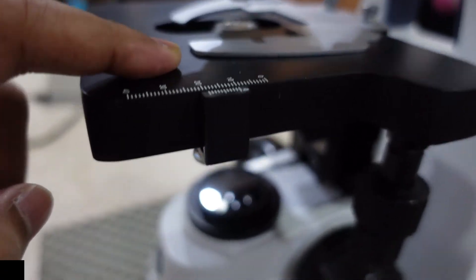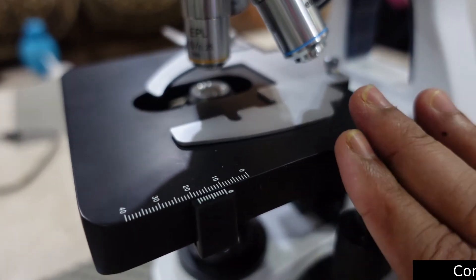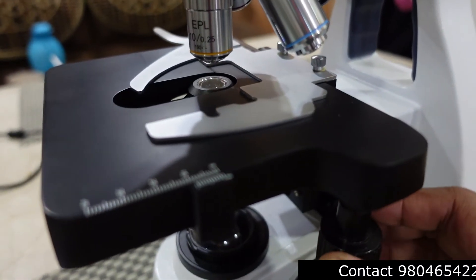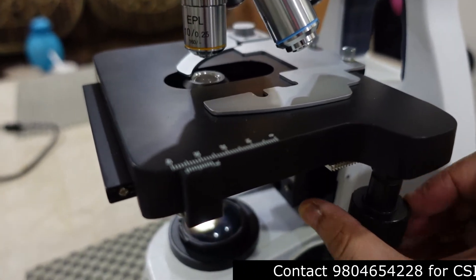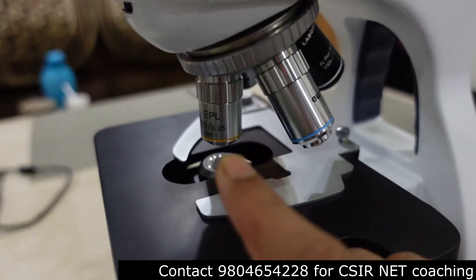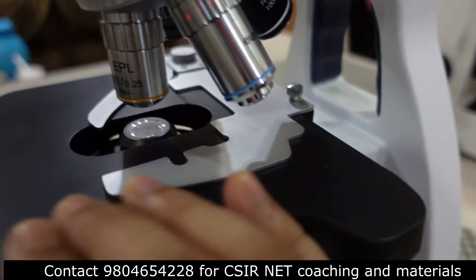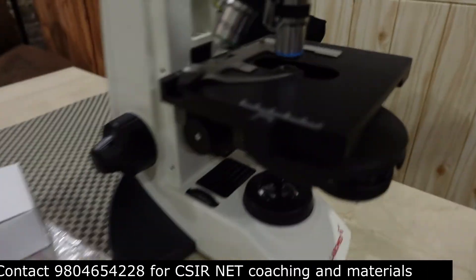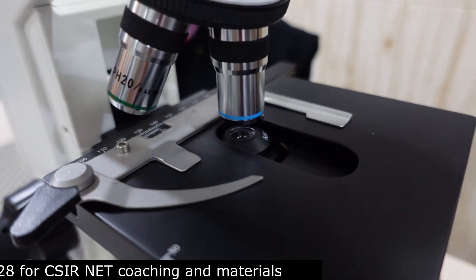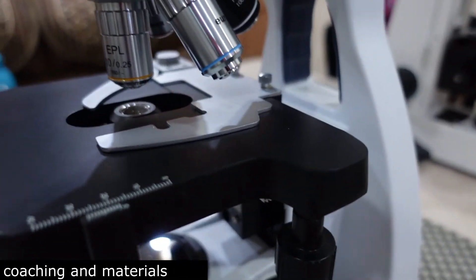After the diaphragm, we have the mechanical stage, whose role is to hold the slides. We'll discuss how to put slides and view them in the next lecture. The stage allows forward, backward, left, and right movement to position the sample specimen in front of the objective lens.